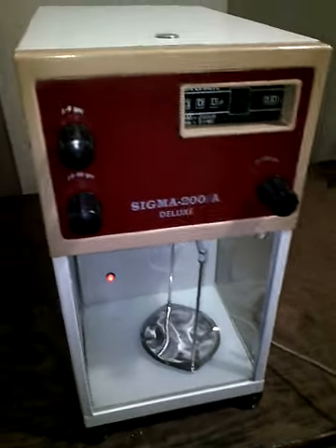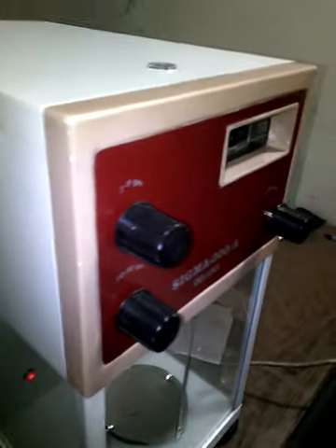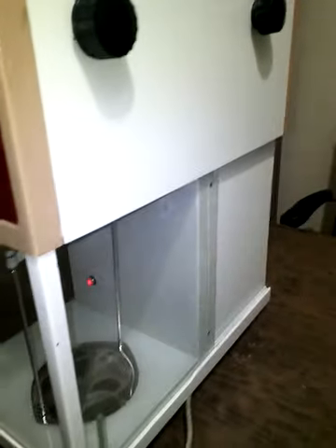How to install a single pan electrical balance. This is a single pan electrical balance. This balance has best accuracy and is very sensitive to surrounding conditions. For its best performance, it should be kept in a dust-free room with no sound and other kinds of vibrations.